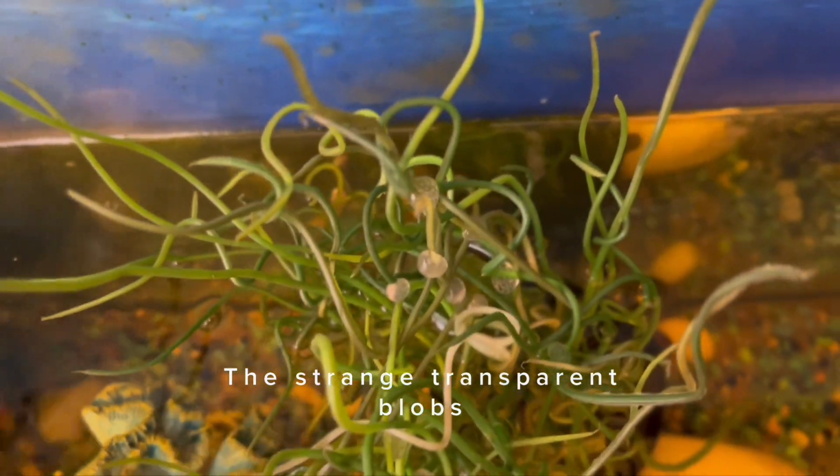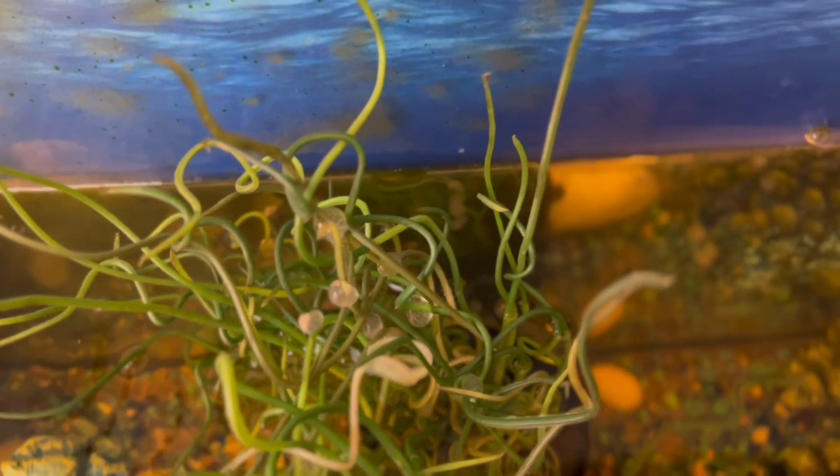We were about to clean up our aquarium when we noticed a few strange transparent blobs sticking on the wall of the aquarium. Then I remembered reading in one of the library books that they could be snail eggs. I had to put it under the microscope to find out what they were.